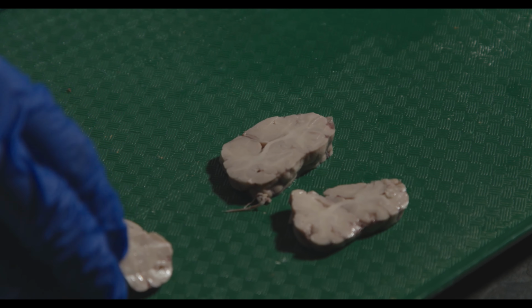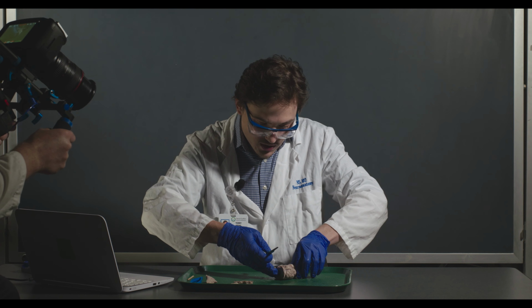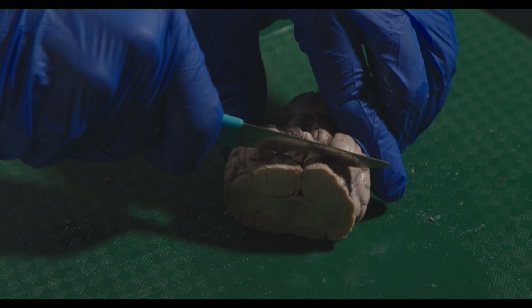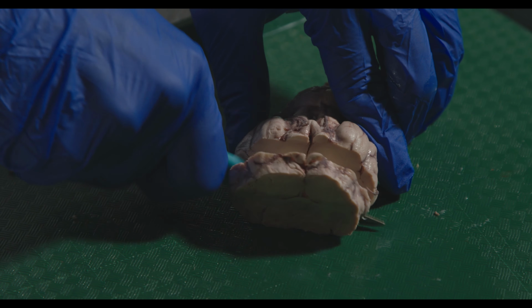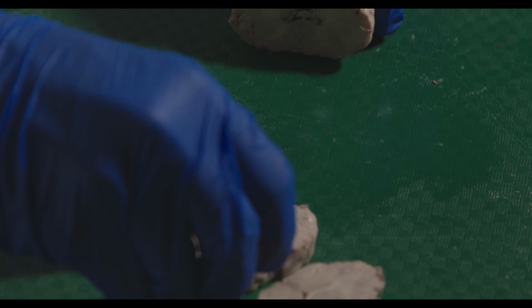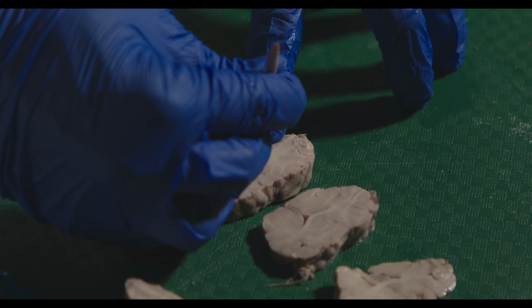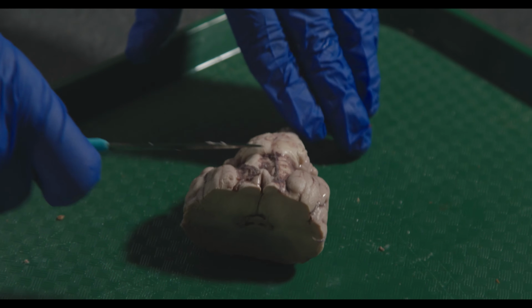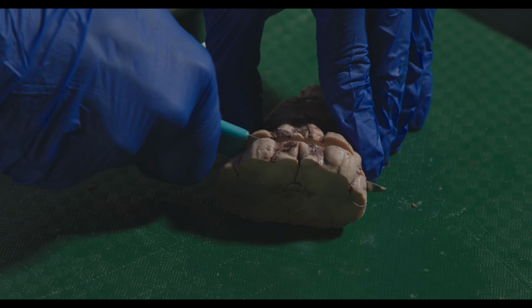What I'm looking for when I'm doing these cuts is the structures on the ventral surface that I want to cut through. So for this next cut, I want to cut through the chiasm. I'm going to try and cut at least through where it was and do our best. That's a nice one. All right, for the next one, we're going to want to go back a little bit, maybe through the mammillary bodies, because we're going to want to get through the thalamus.